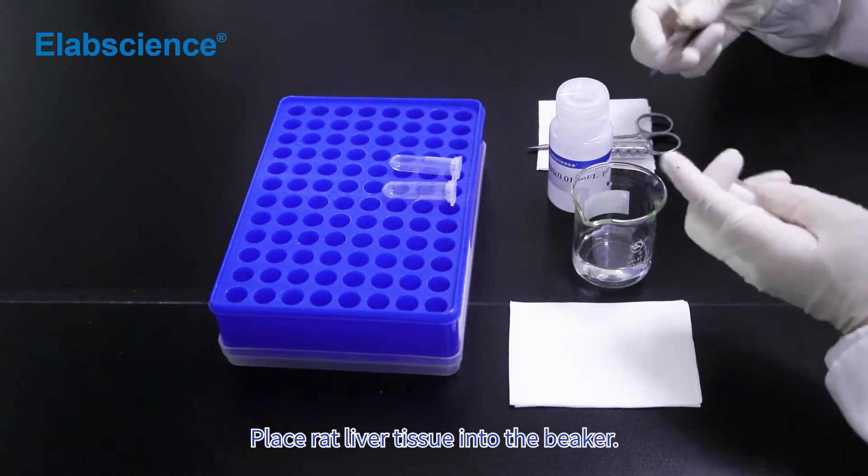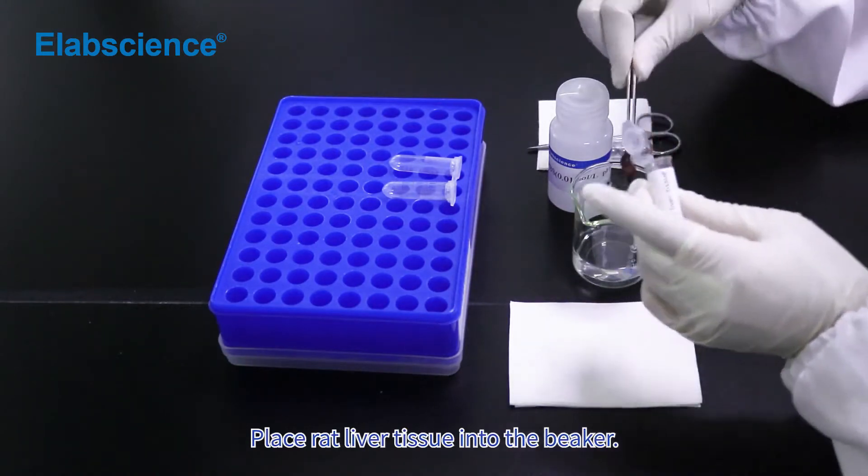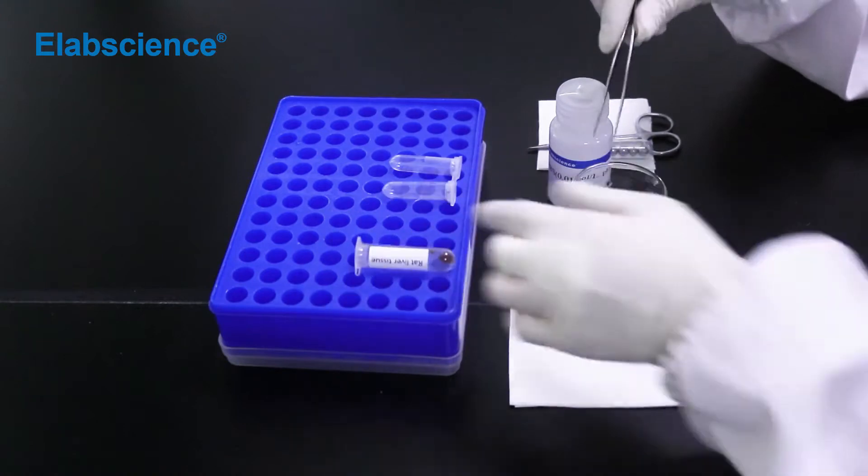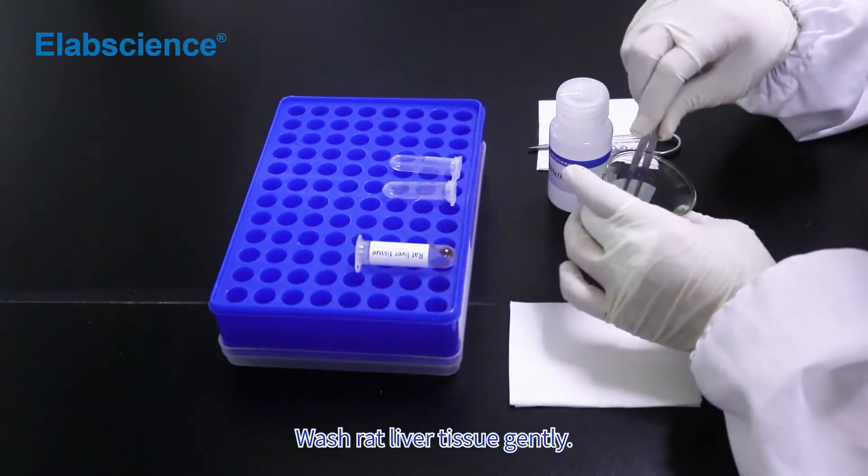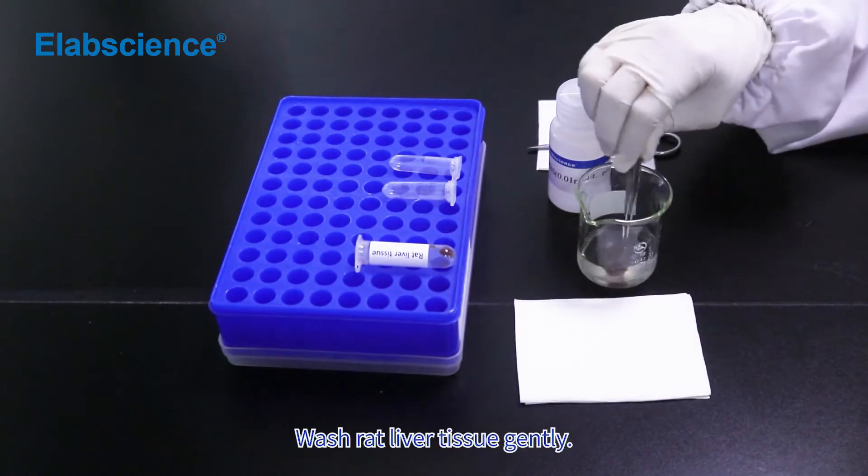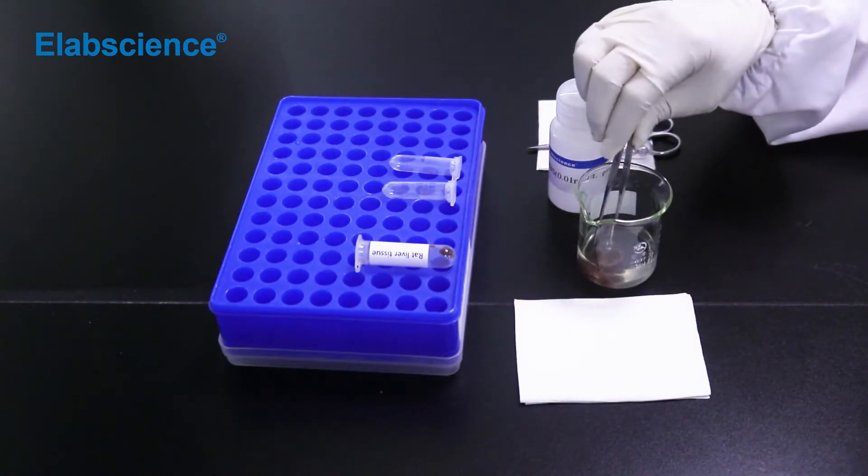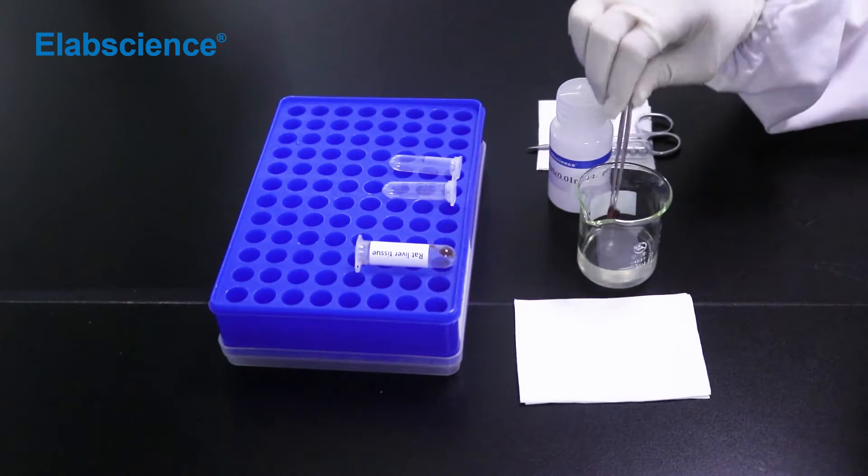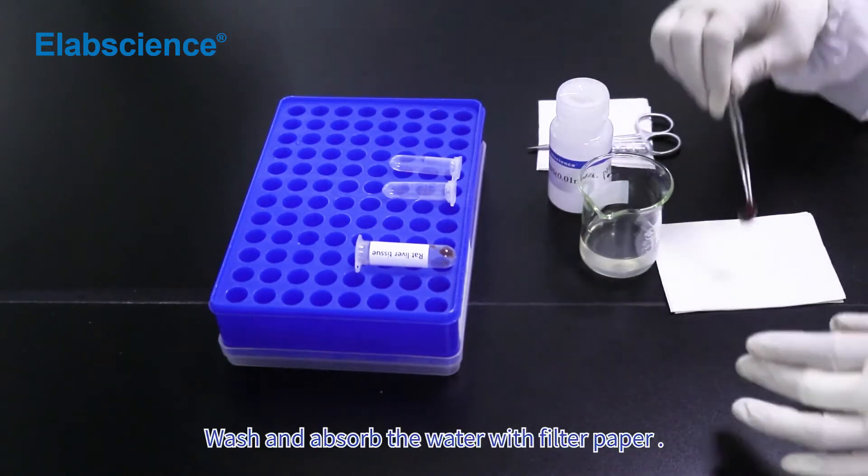Place rat liver tissue into the beaker. Wash rat liver tissue gently. Wash and absorb the water with filter paper.